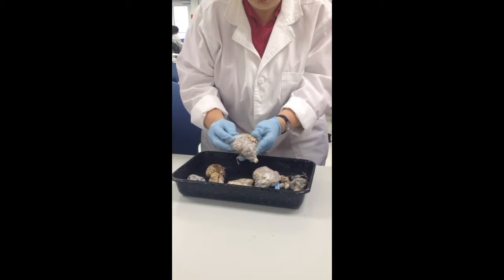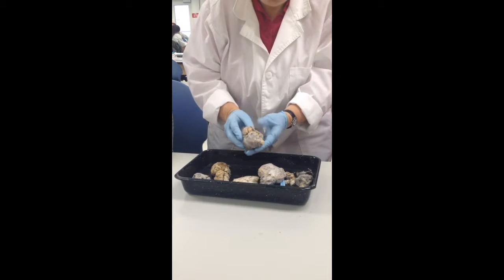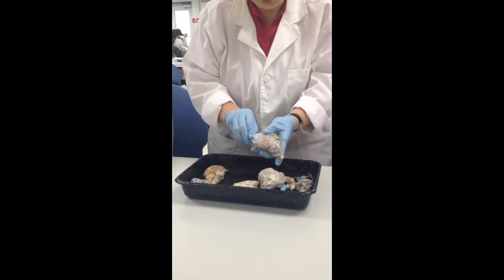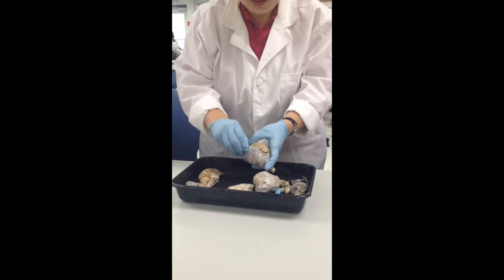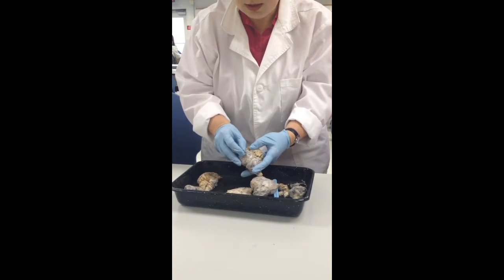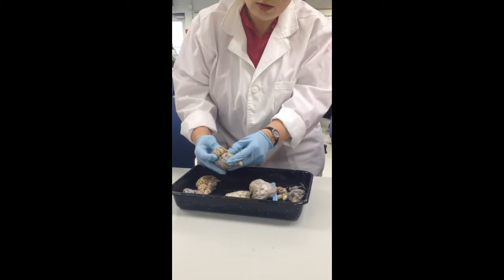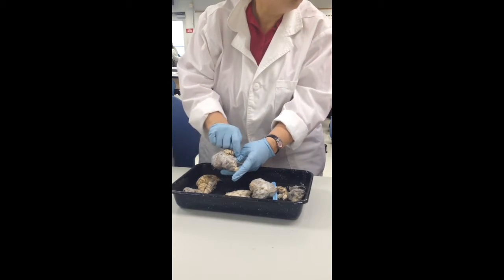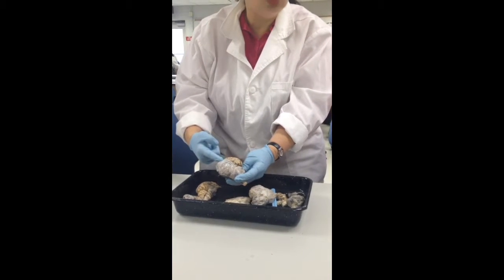Okay, now when you look at the brain hemispheres, you see these folds. So what are these folds called? Gyri. Okay, and when there are shallow grooves, they are called sulcus. Okay, how about when it's right down deep in here? Fissure. Okay, all right, so this fissure here is which one? Longitudinal. And the fissure right here between the cerebrum and the cerebellum? Transverse. Transverse fissure and longitudinal fissure.